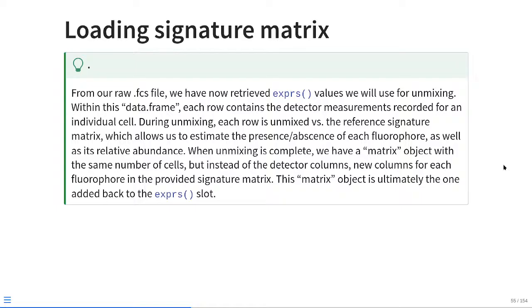Alright, so from our raw FCS file, we have retrieved out the exprs values that we'll be needing for unmixing. So within this data frame, each row basically corresponds to the detector measurements recorded for an individual cell. During unmixing, each row is unmixed versus the reference signature matrix, which allows us to estimate the presence or the absence of each fluorophore, as well as its relative abundance. When unmixing is then complete, we end up having a matrix object with the same number of cells, but instead of the detector columns, we have new columns that will correspond to the fluorophores that were provided within our signature matrix. This matrix object is then ultimately added back into the exprs slot.